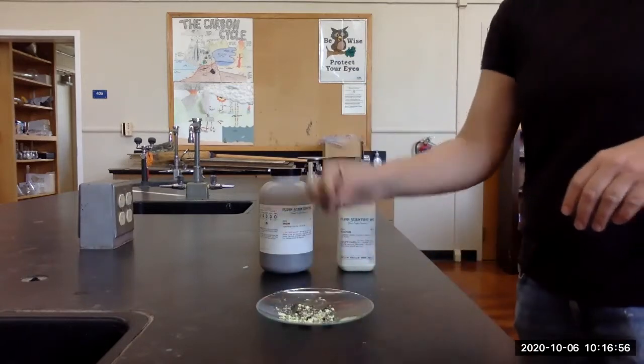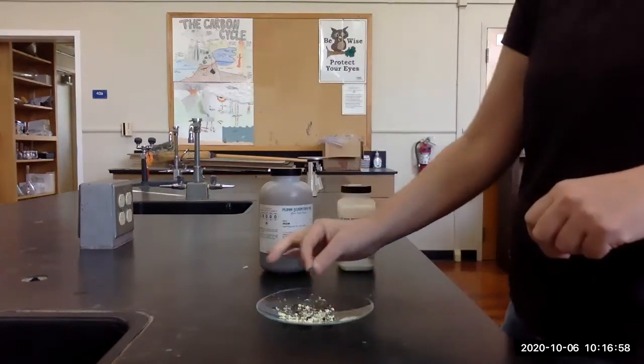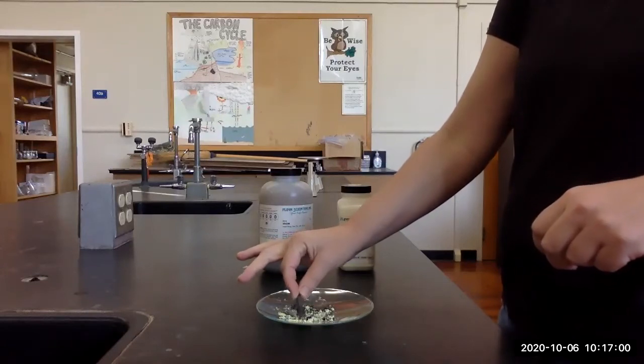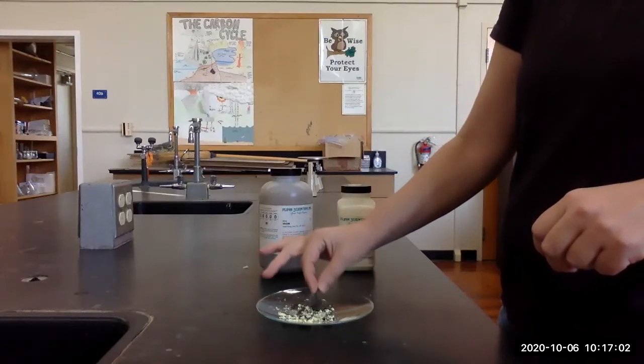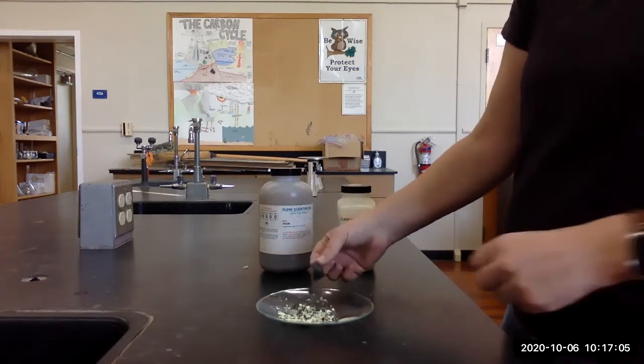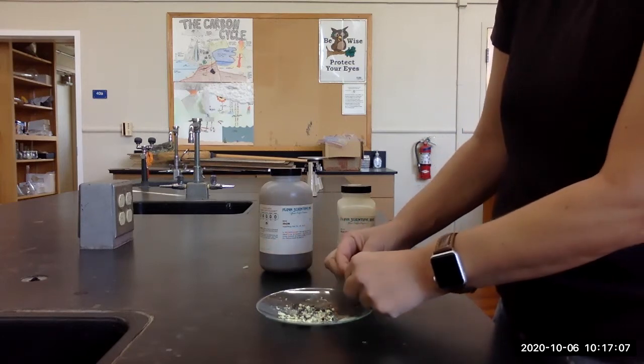Then I can take this magnet and I can separate my iron filings and my sulfur.